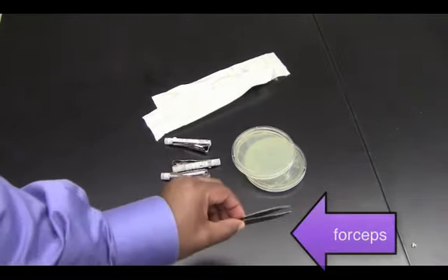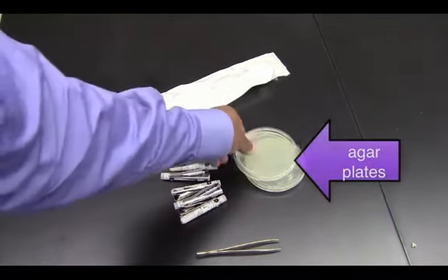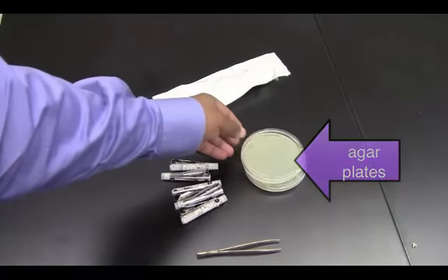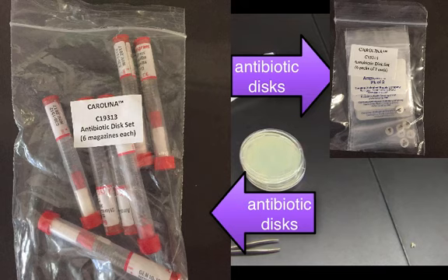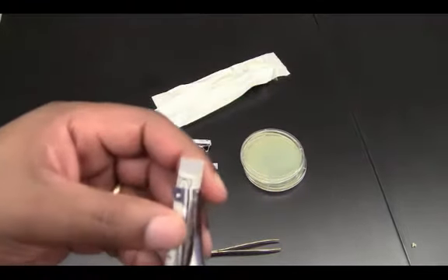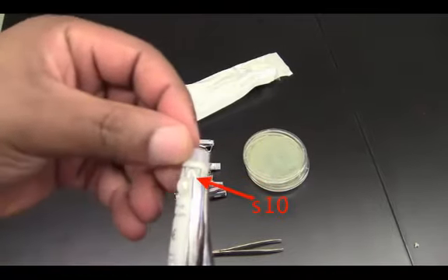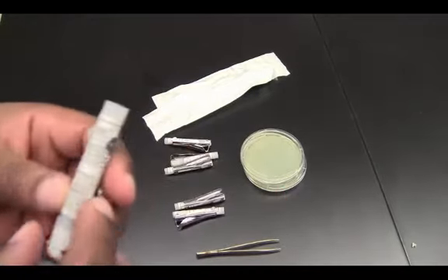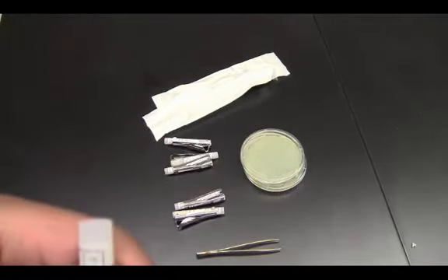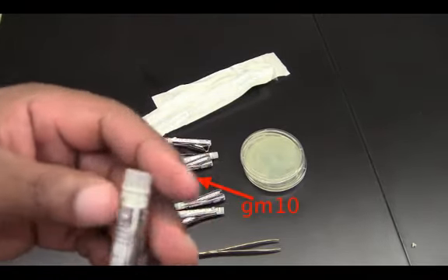We have forceps for transferring the antibiotic disc. We have our plain agar plates, and we have our antibiotic discs. And each of these has a different type of antibiotic on it. So if you look at the label, it's hard to see, but this says S10, and you kind of have to look on the labels for the other antibiotics. This one, if you can see, is GM10.